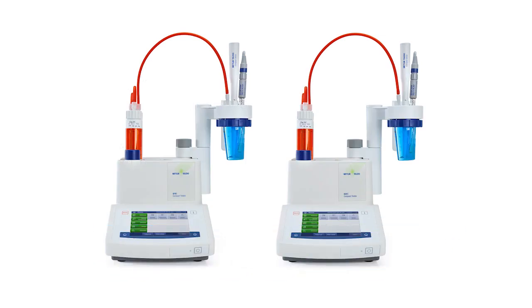Titer determinations. Most users purchase a pre-standardized titrant and initially skip this step. In cases where labs make up their own titrant or would like to use a titrant that has been around for a while, the titrant can be standardized with the titer determination method.